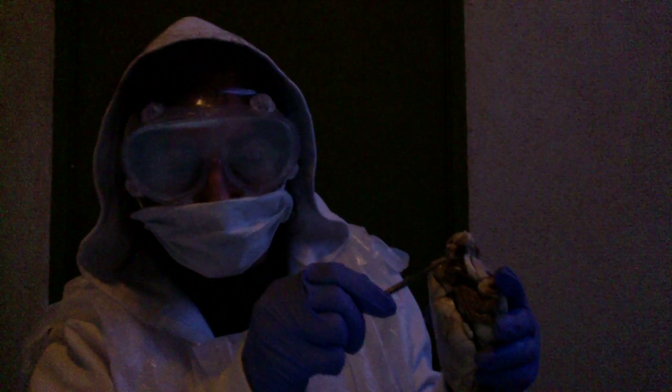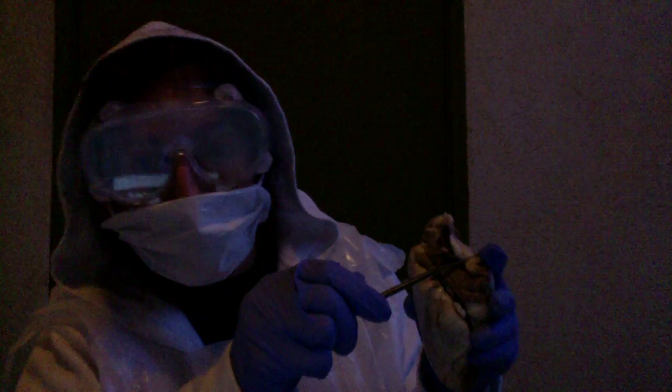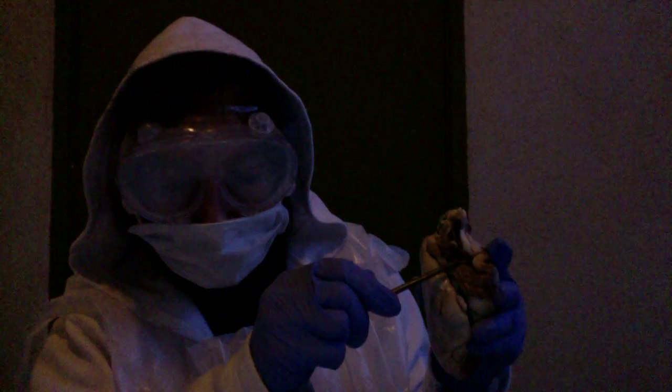Oh, my apologies, my fingers are a little stuck here. The superior vena cava and the inferior vena cava, and the coronary sinus.